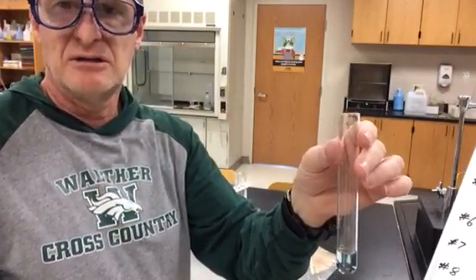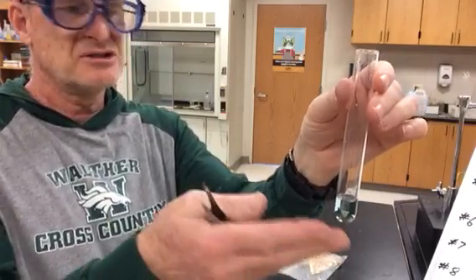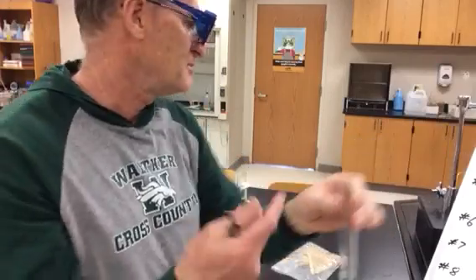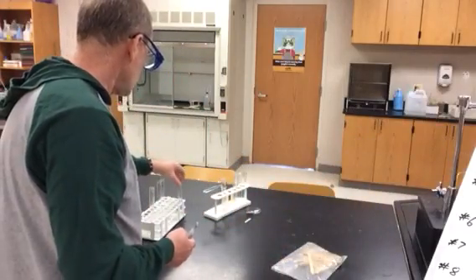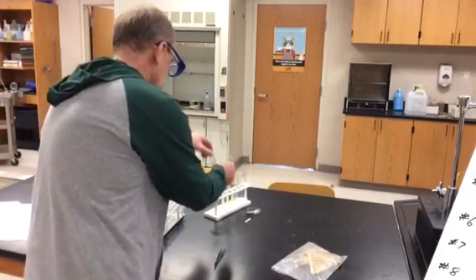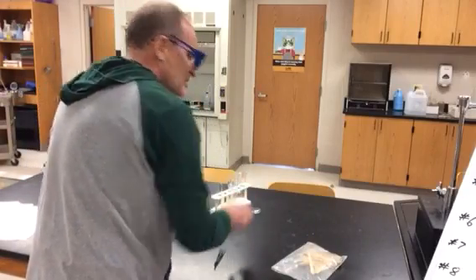The first 4 that we had, they happen almost instantaneously. So this one, let's put it down for a couple minutes. We'll come back to it towards the end and see if we get a change that's a little more noticeable, because it is one that takes a little bit of time. All right? So I'll set that one off to the side, and we'll come back and look at that in a few minutes.